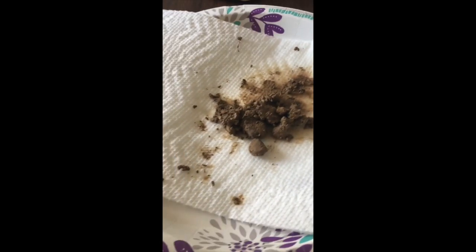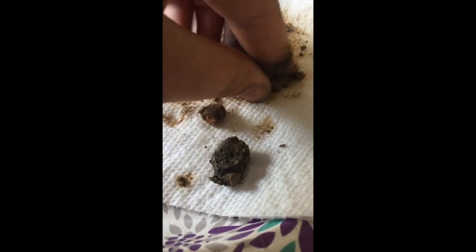Now we're going to move over to the field soil and compare the same things. Get my hand a little cleaned off, flick it off. And here we go with this one. I will say with the field soil, it feels a lot more clay-like. The forest, I believe, does have some clay in it, but it feels a lot siltier. And here we have some pretty big aggregates, like right there. I can't break that up at all. I'm putting pressure to it and it won't break up. That's a little rock right there.